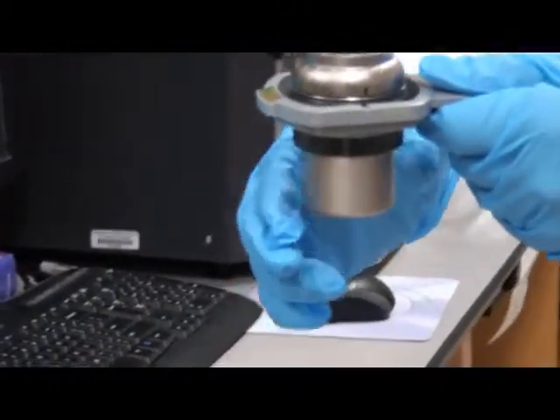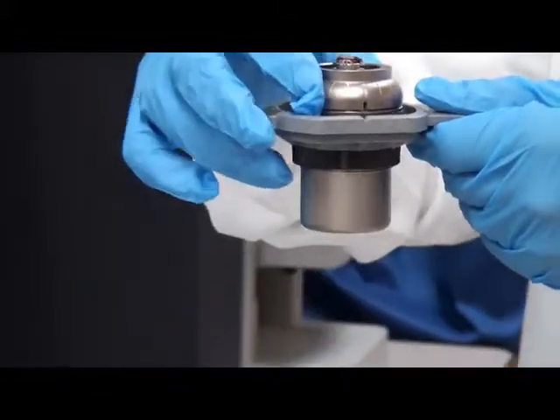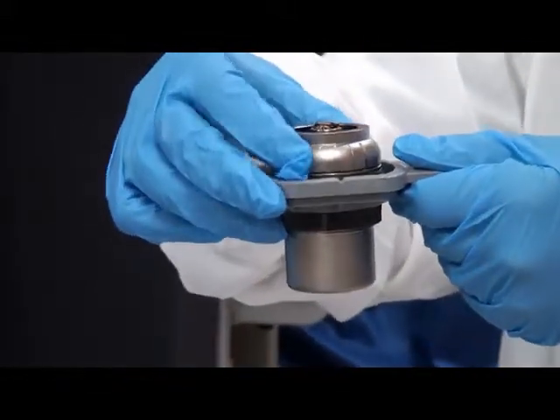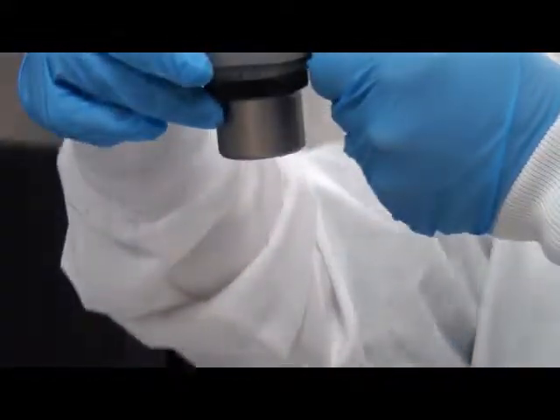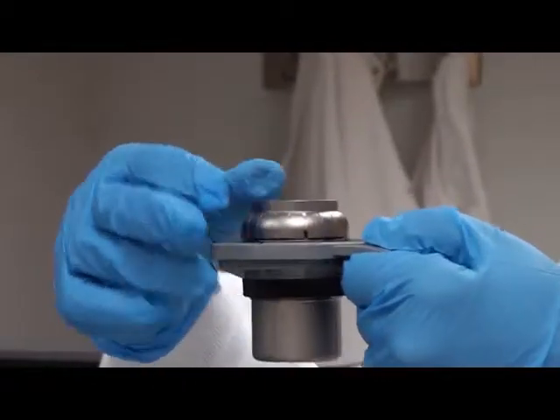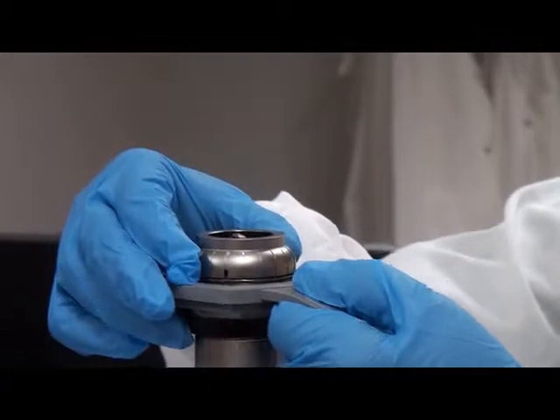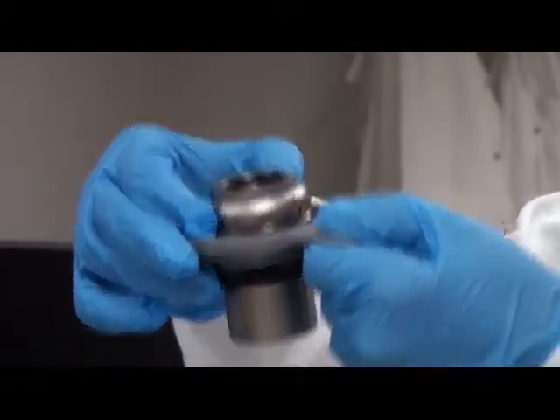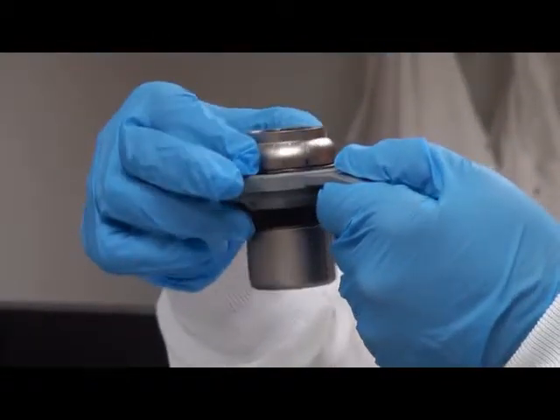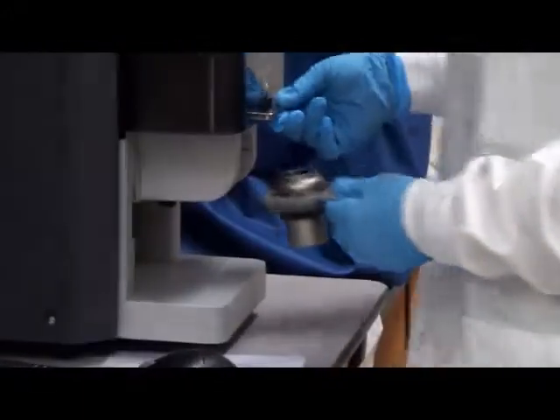Once we have this, we have to make certain that the mounted sample's highest point is below the lip of the sample holder. And then we have to make sure it is 4 more notches down, so we take it even further down. Now it is ready to be analyzed and we put it under the chamber.